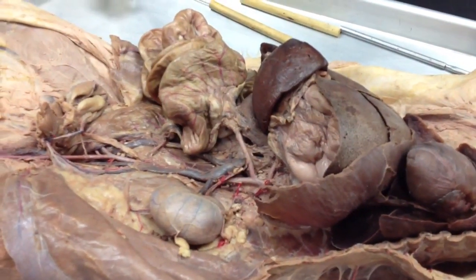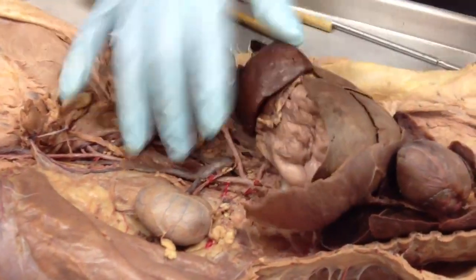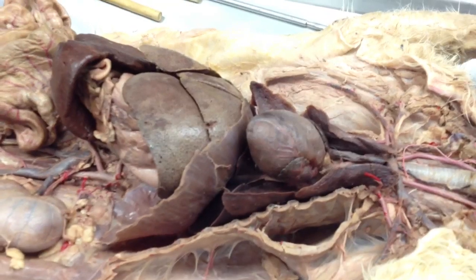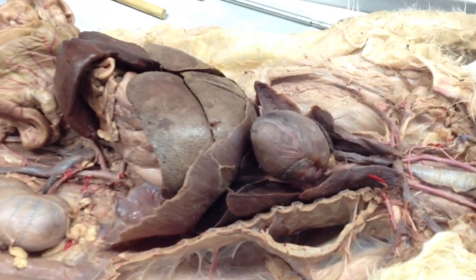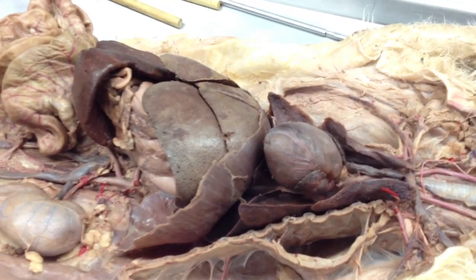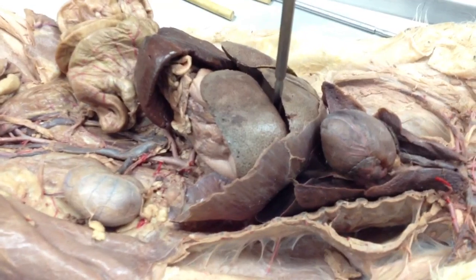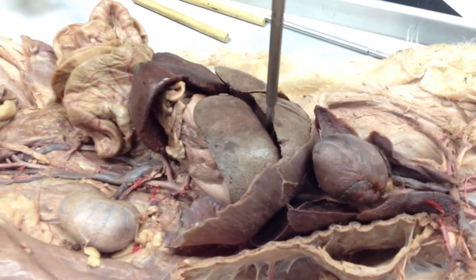So it takes blood from the small and large intestines to the liver, where the blood's processed. And I mentioned the inferior vena cava runs directly through the liver. After the blood is processed, the hepatic vein takes it from the liver to the inferior vena cava, which runs it back up to the heart. So that flow of blood makes sense: hepatic portal vein to the liver, from the liver to the hepatic vein, then the inferior vena cava. So if I have a pen sticking right here and I ask which vein is most associated with the liver, you'd answer hepatic vein.